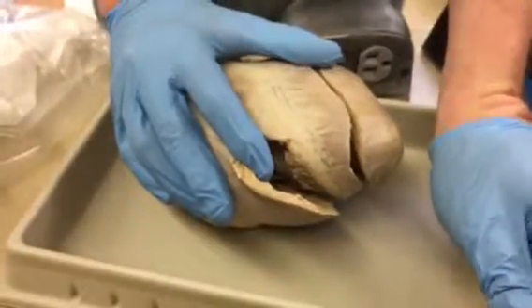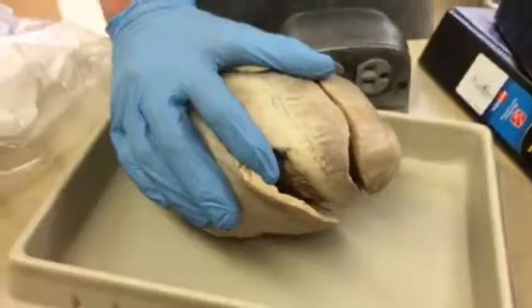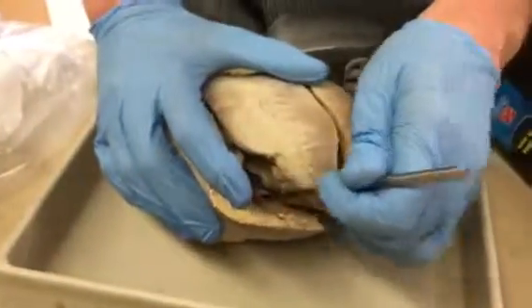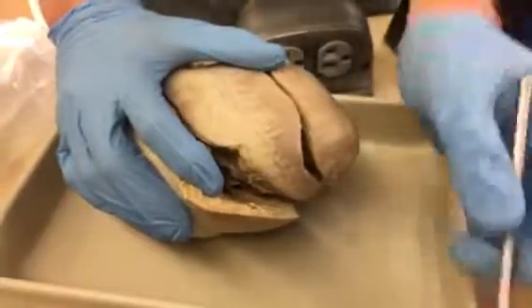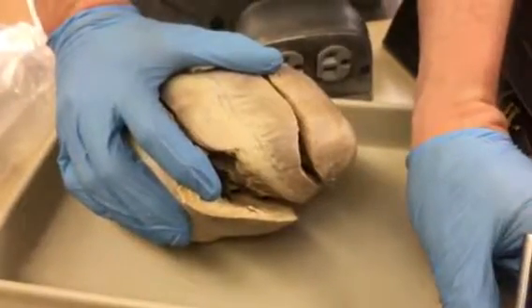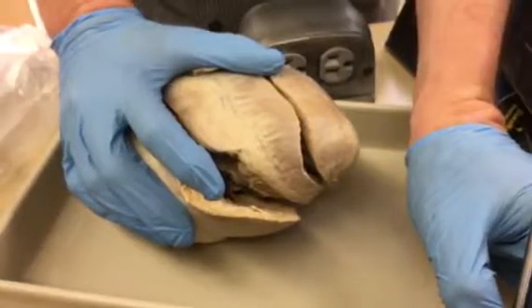Those are the trabeculae carneae, which literally means bumpy meat. So this is the bumpy part of the interior that doesn't have these guys attached, the chordae tendineae or tendinous cords, okay? So if it's got a cord, you say papillary muscles. If it doesn't have a cord and it's a bump, you say trabeculae carneae.